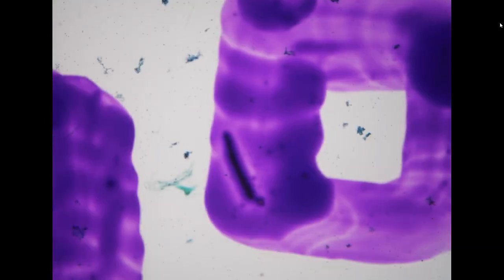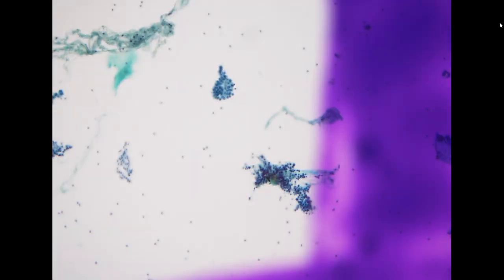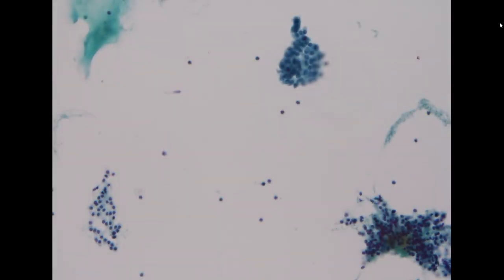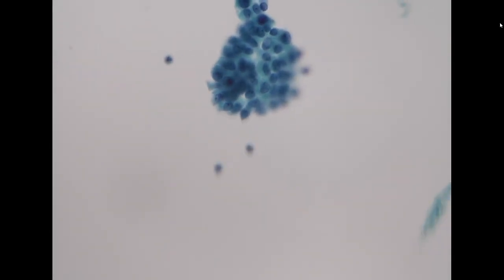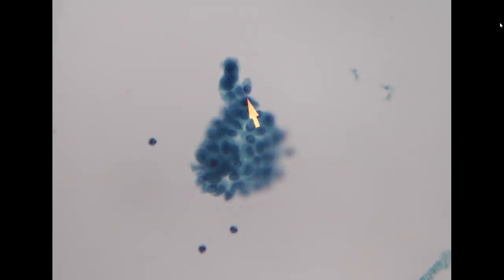Next, this is cytology from a thyroid aspiration. The specimen is a little bit tricky because it seems to be two different populations. The first population here, you can see that it is three-dimensional, and you can appreciate a cell with a single pseudo inclusion within the nucleus. So this looks like a PTC. This is a PTC.